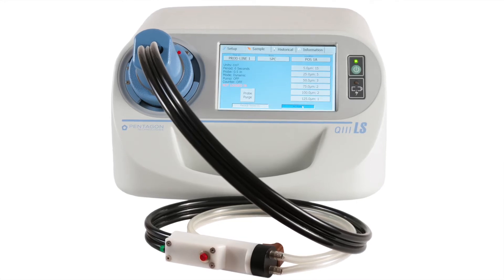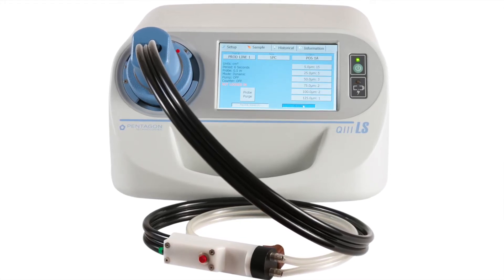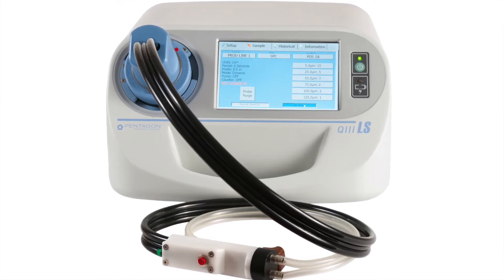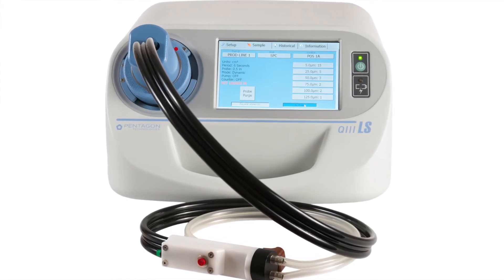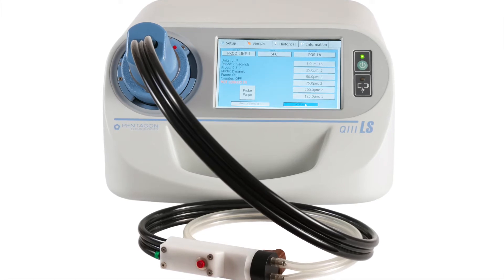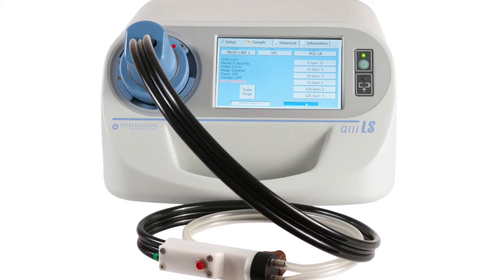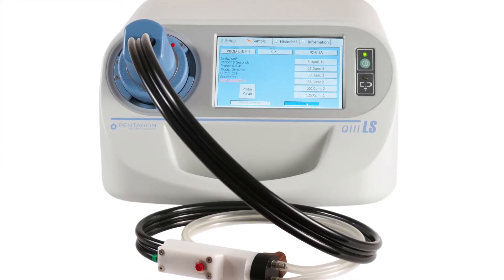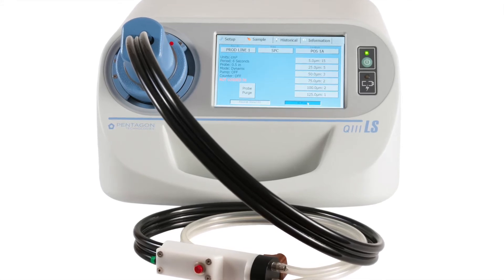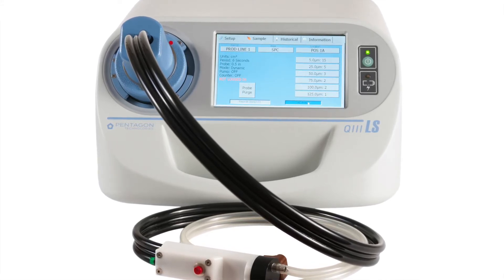Particles that accumulate on your surfaces or product can decrease yield and reliability. Particles below 100 microns are difficult to see with the human eye, especially on rough surfaces. Large particles settle fast and escape normal air particle monitoring.